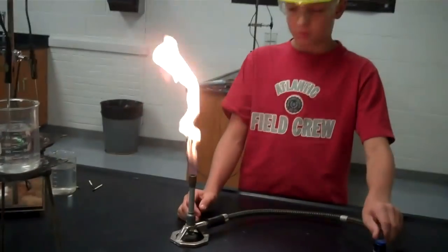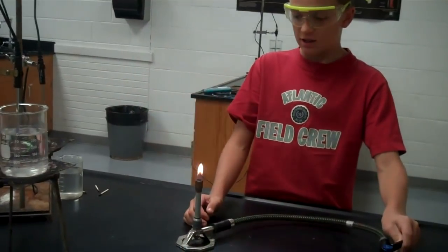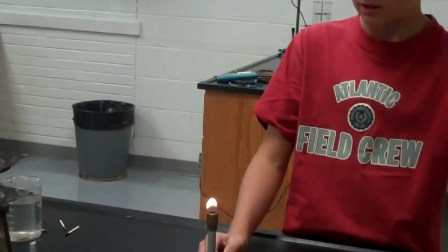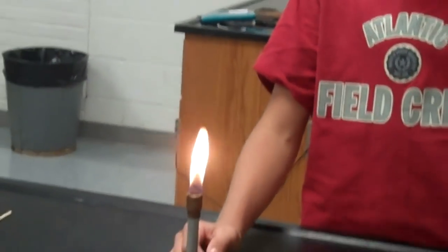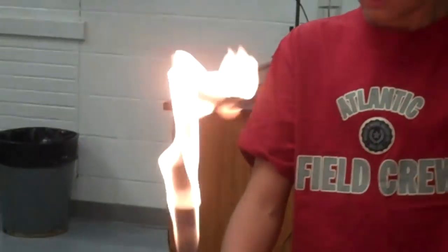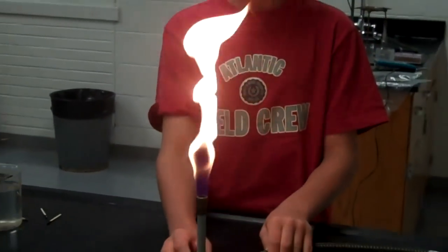And then you can play with the height of the flame, and then bring it back, and then just adjust this.